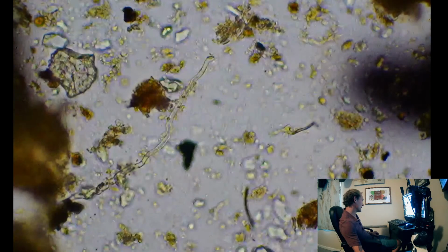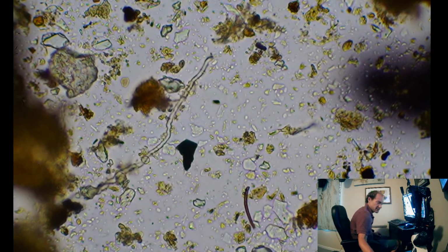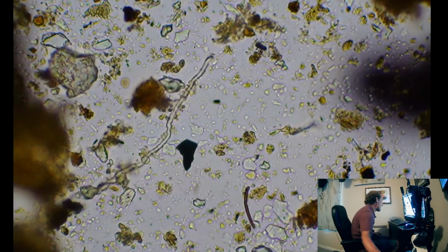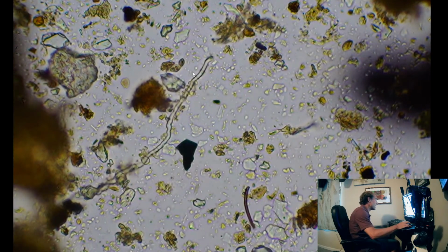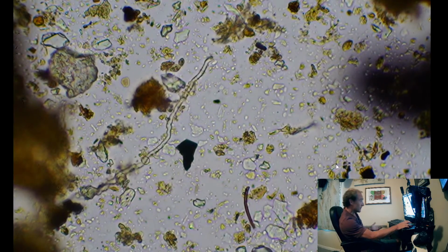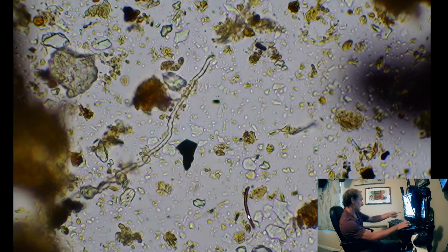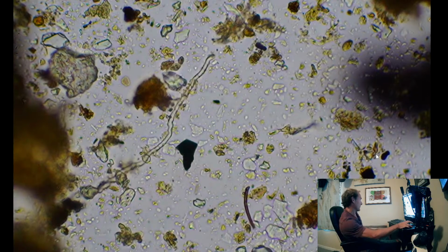But anyway, alright, we're kind of just circling around, hoping to see some more interesting stuff. And so here's an example of a saprophyte. So you can see how I can definitely make out a septi there, and I can make a septi there. It's very clear. Could actually be some other type of fungi, but it's very young and hasn't filled up with nice color like this one over here because it just hasn't eaten much.